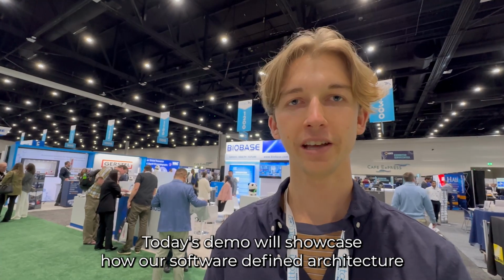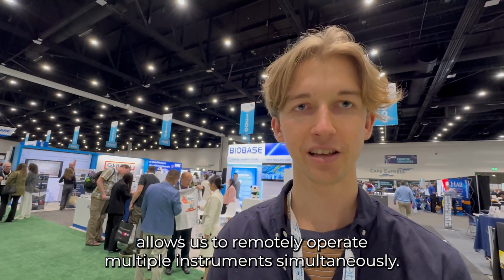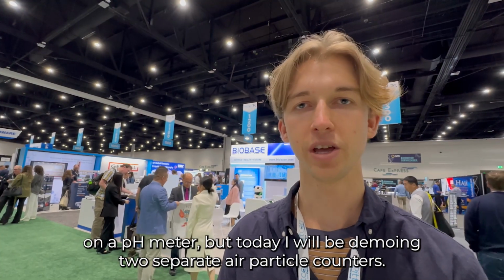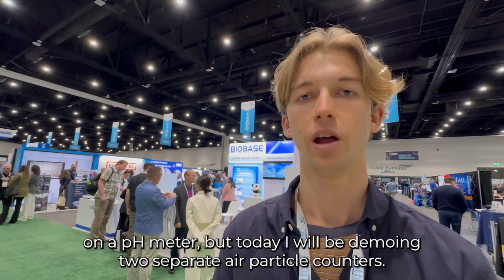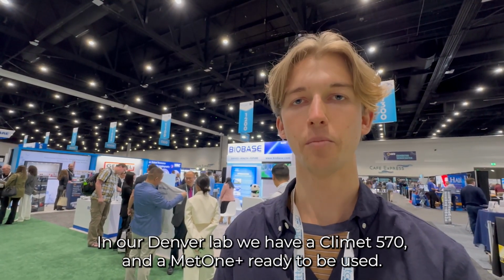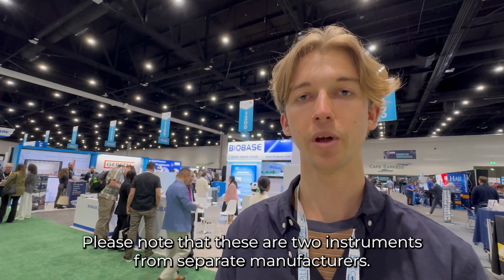Today's demo will showcase how our software-defined architecture powering Digital Air allows us to remotely operate multiple instruments simultaneously. It could be a pH meter and an air particle counter, or a balance and a pH meter. But today, I will be demoing two separate air particle counters. In our Denver lab, we have a Climet 570 and a Met 1 Plus ready to be used. Please note that these are two instruments from separate manufacturers.